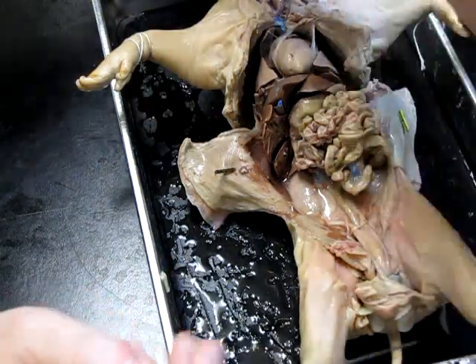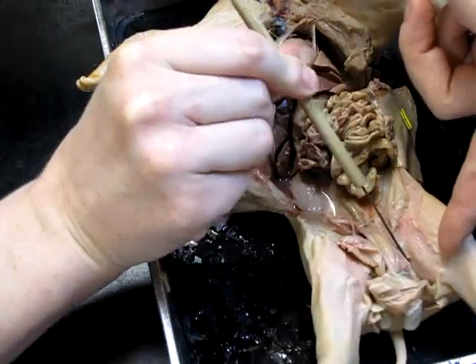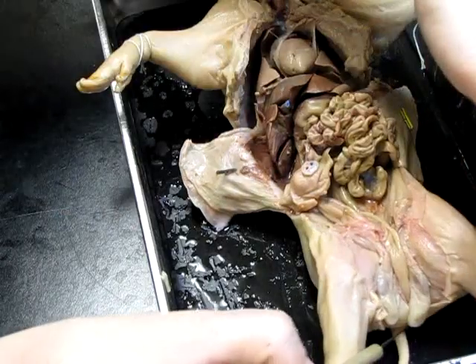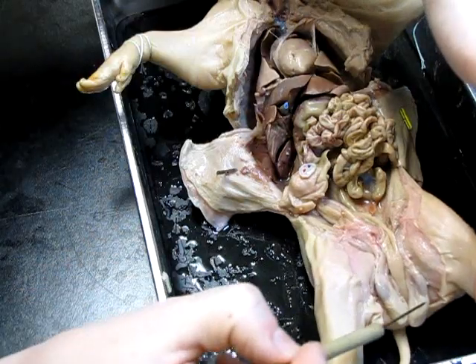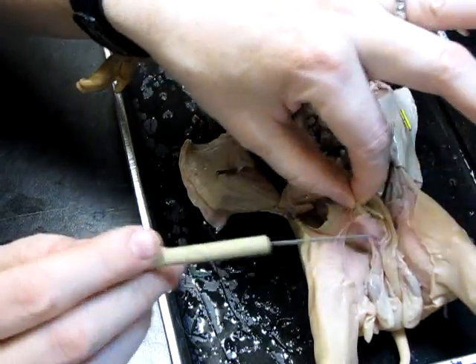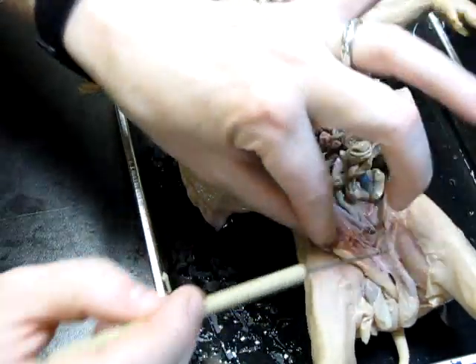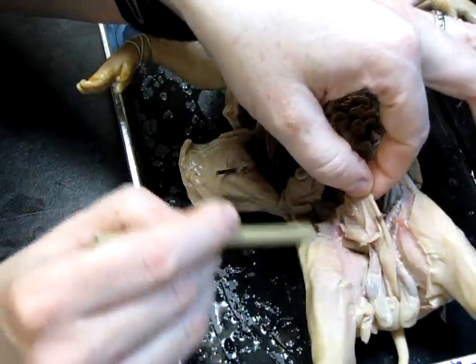I'm going to look for the male organs. The best way to do that is to make some incisions down into the groin area, basically into the scrotal area of the animal. I've gone ahead and made some incisions here. What I've been able to remove — you can see this structure and another one on this side — these are the two testes. The penis would be more in this area, and the opening for the urethra and where sperm would be coming out would be in this general area.